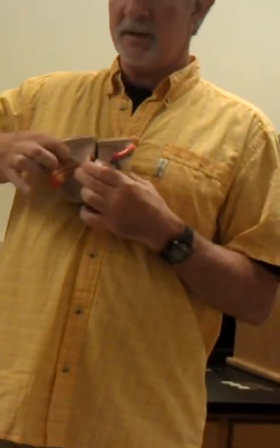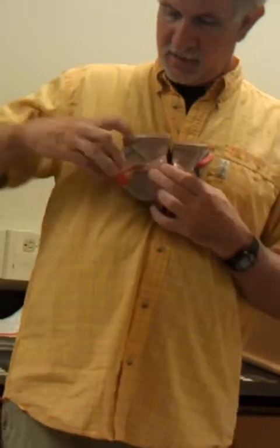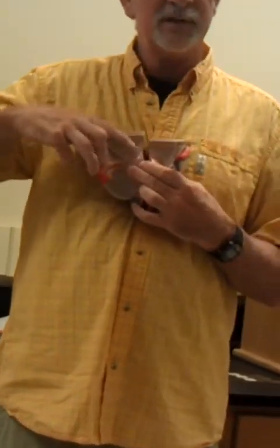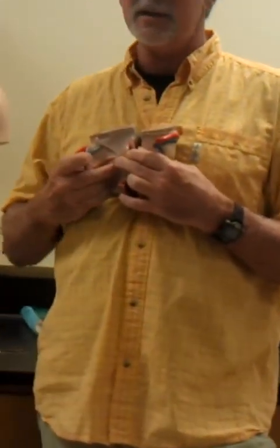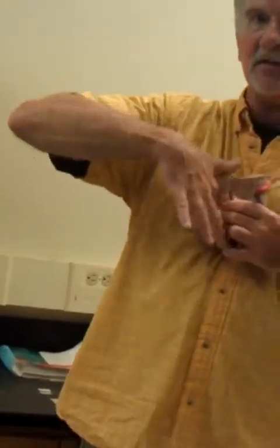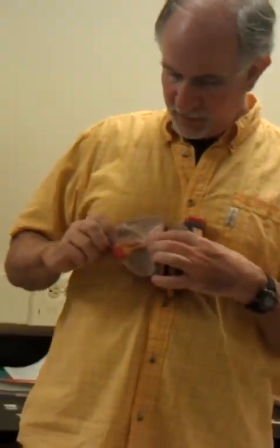All of this would be the broad ligament, up and down. That's all three ligaments. The round ligament attaches the uterus to the body wall. The cord-like ovarian ligament attaches the ovary to the side of the uterus. And all of this sheet-like ligament is called the broad ligament, and everything is kind of embedded in it.